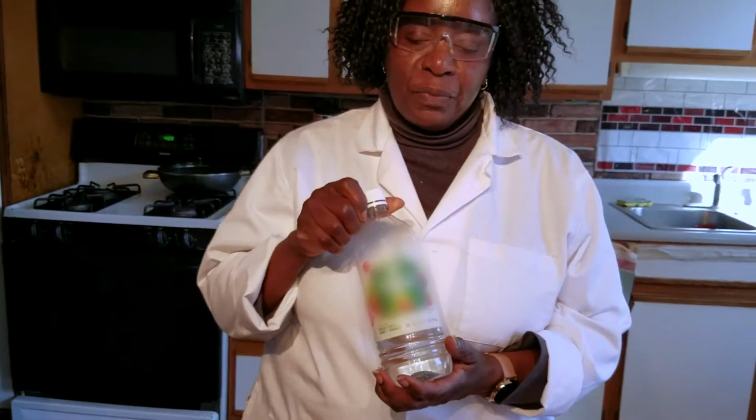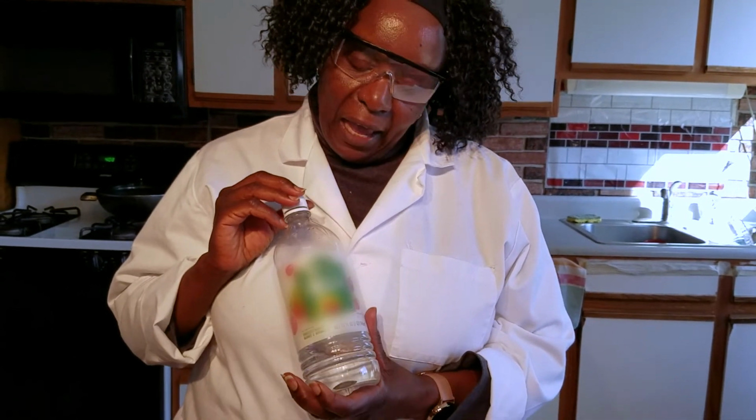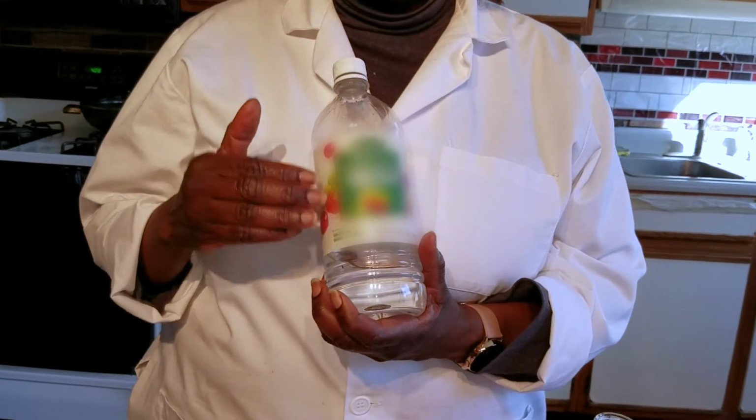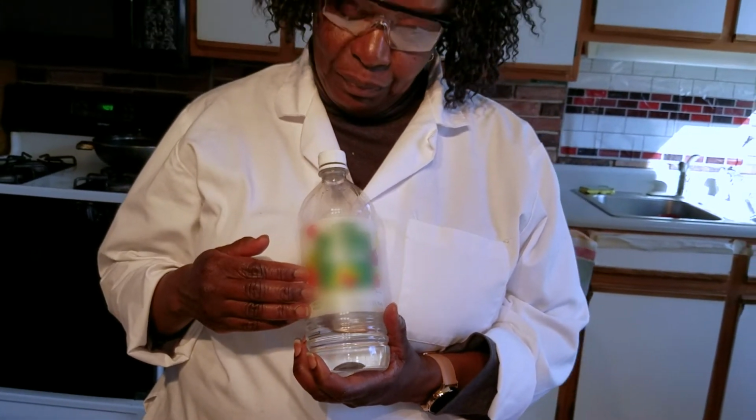In the past, we've been talking about acids and bases, and one of the household products that we indicated fed into this category was vinegar. We were able to establish that vinegar is an acid. And so in today's lab, we want to find out exactly how much acid is in vinegar. In other words, the percent acid in vinegar.